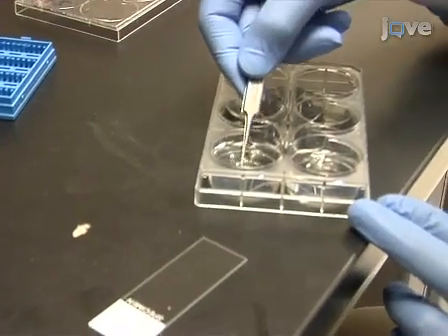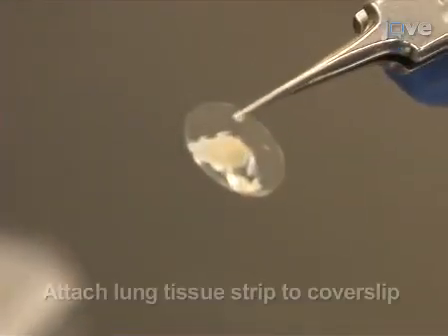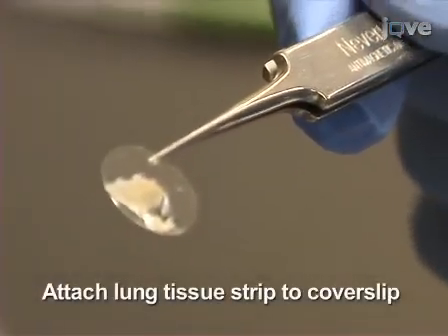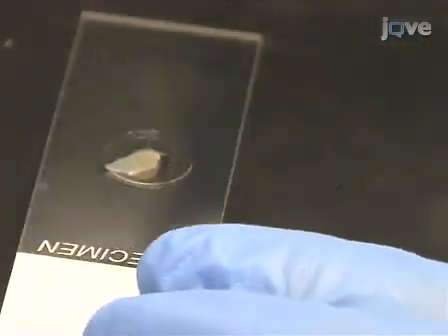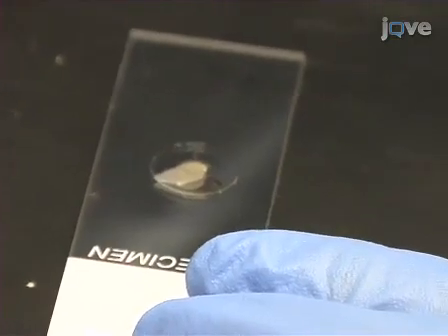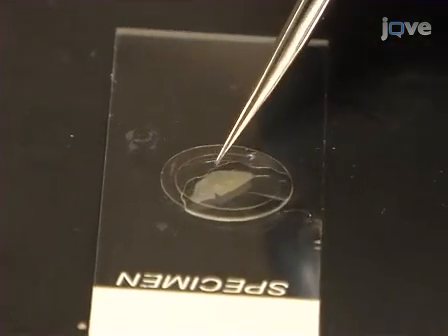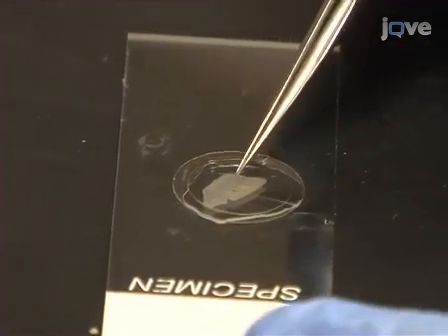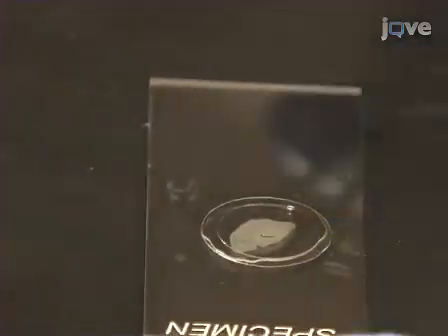Immediately before AFM characterization, attach the tissue strips to poly-L-lysine-coated 15 mm cover slips by raising the cover slip from below the floating tissue, making sure the tissue strip spreads evenly on the cover slip surface. If necessary, sandwich the strip with a second clean, uncoated cover slip and apply mild pressure to assist with tissue attachment to the poly-L-lysine-coated cover slip.